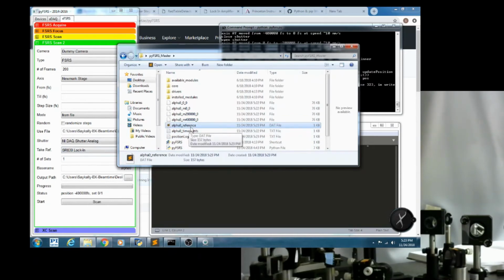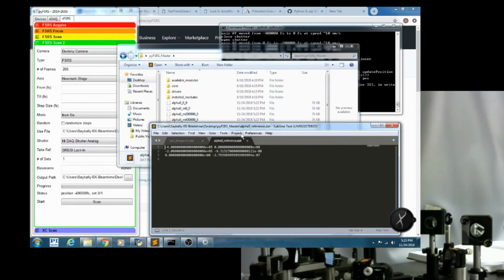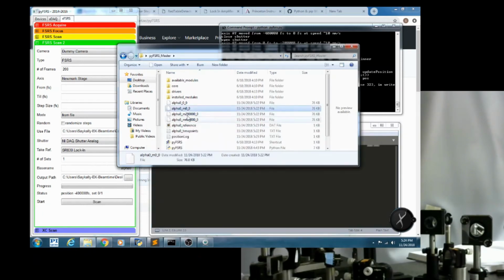Then we also have alpha reference. This is the output of the lock-in amplifier. So let's take a look at that. So here on the left we see the time point, and on the right we see the readout from the lock-in, which right now is just noise because it's not reading anything.